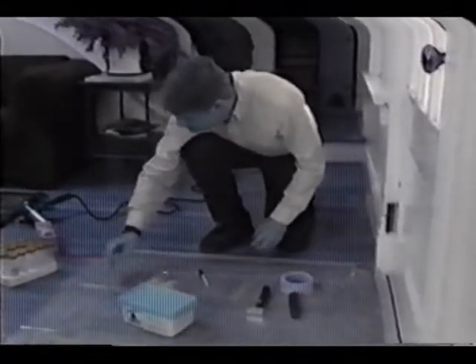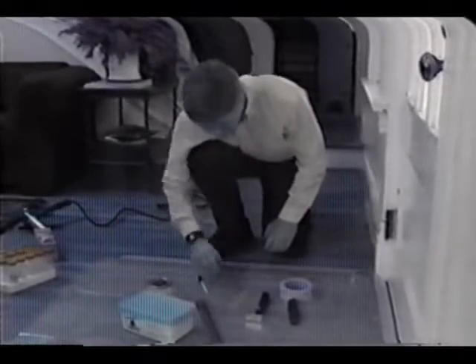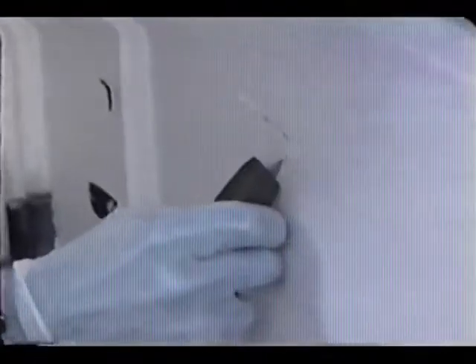You will need to set up some kind of containment to prevent paint dust from spreading, usually a piece of plastic sheeting under the area to be sampled. Now you're ready to put on the disposable gloves and take the chip sample. You may use a heat gun to soften the paint before removal and to help you scrape off only the paint and not the substrate. Attempt to remove all the paint, but none of the substrate.